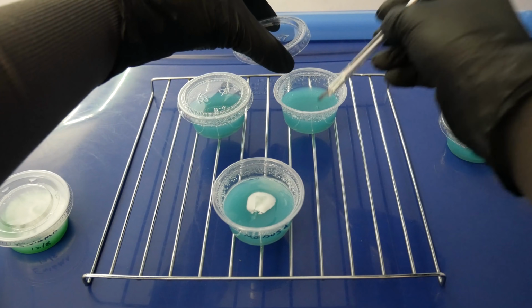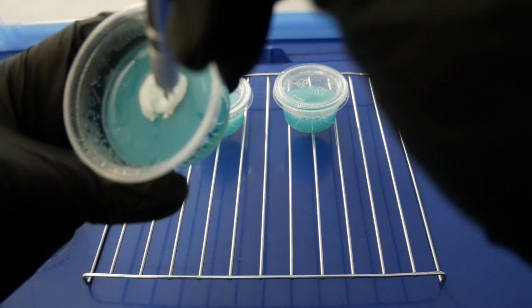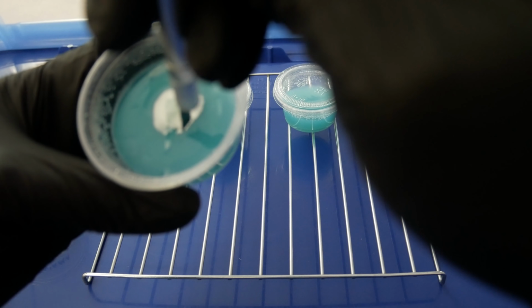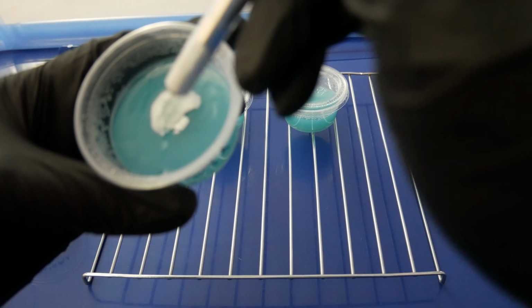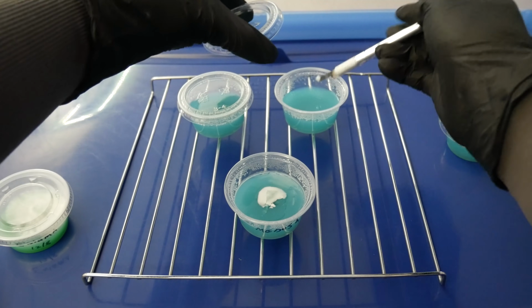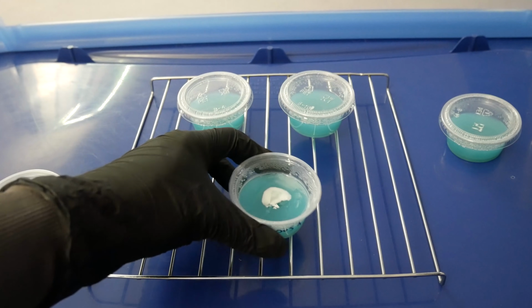Another thing that I'm constantly trying to do is avoid keeping my hands over the cup. You never know when something on your hand or gloves might fall into the cup as you're working, so I try to be mindful of where my hand is positioned while I'm working inside the still air box. Try to make sure that it's as clean as possible. So I'll go ahead and make another transfer here, close it up, and we'll put those away.